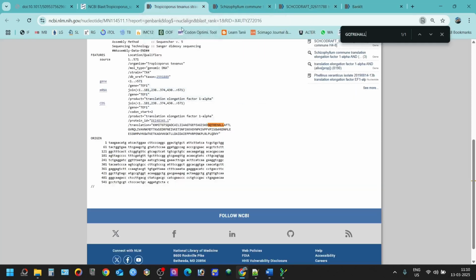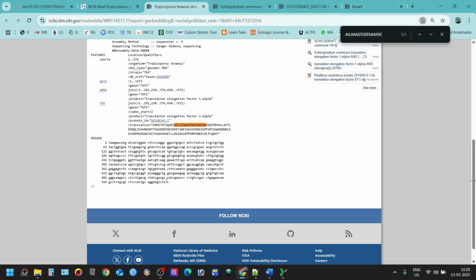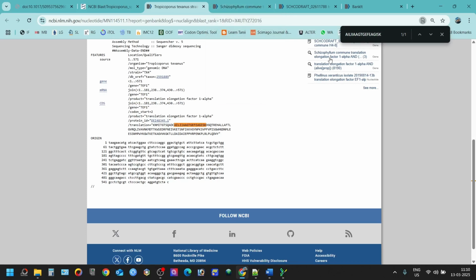So just copy it and paste it here. If it is matching, then your open reading frame is correct. Because sometimes if you choose the wrong reading frame and it is accepted, the amino acid sequences generated from the sequence that you're submitting might not be correct. So to confirm, you have to copy and paste like this to check if the open reading frame is correct or not. If you search it here and it is matching, then okay, your open reading frame is correct.